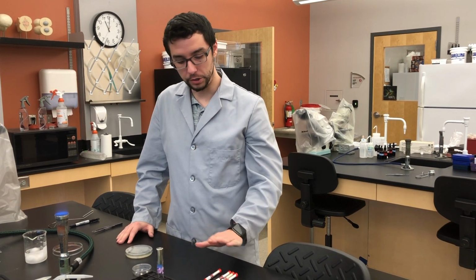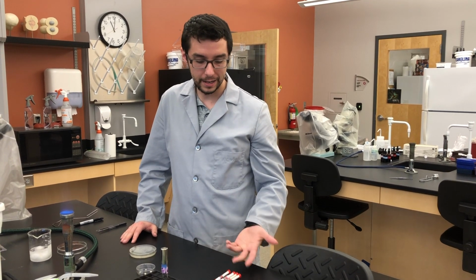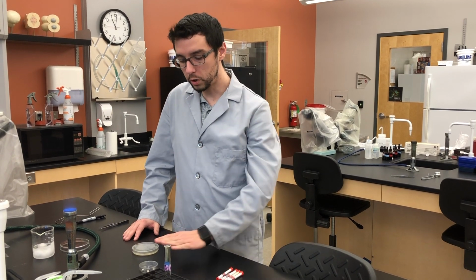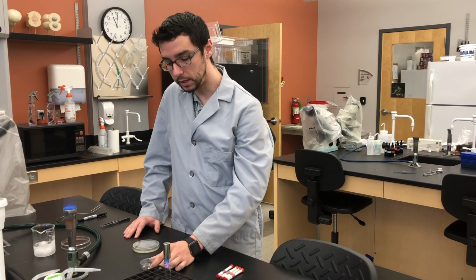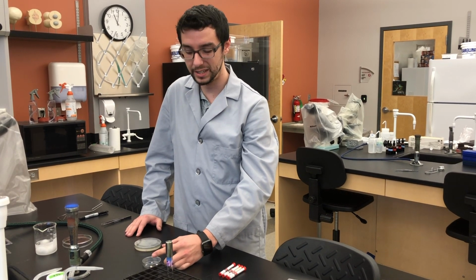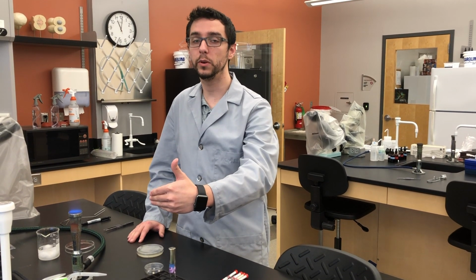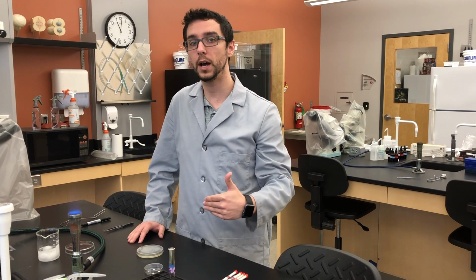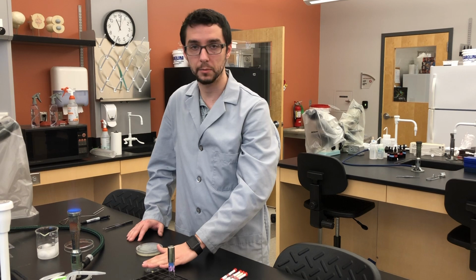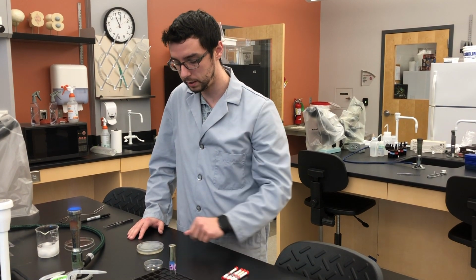Okay? Now, you are not going to be given these tubes of antibiotics. The reason for that is they're kind of difficult to get the discs in and out of effectively. So what we're going to do is provide you a small petri dish with just enough discs in them for you and your lab bench. You should see 2 in them for your whole lab bench because both sides, one's working with Staphylococcus aureus, one side's working with E. coli. Both bacterial species we're going to be testing with the same antibiotics. So there should be 2 discs of each type in this small dish at your bench.